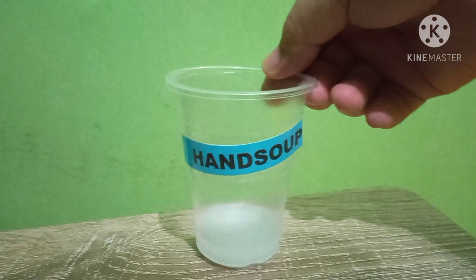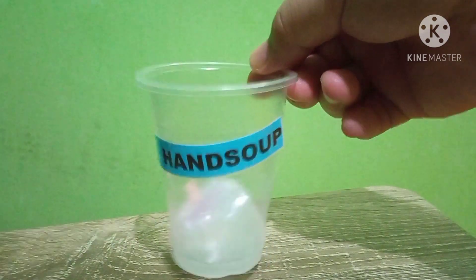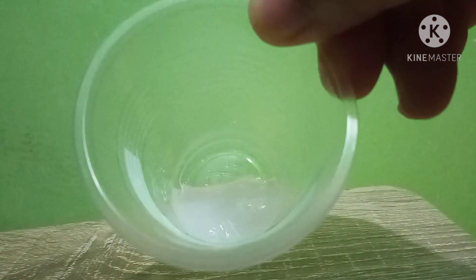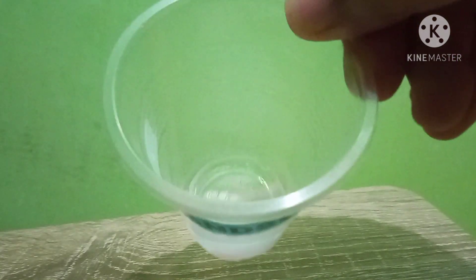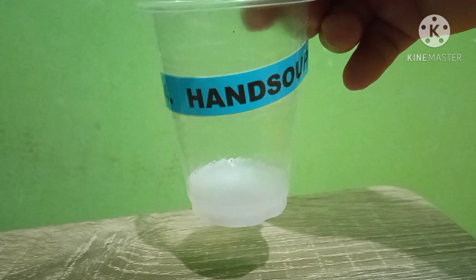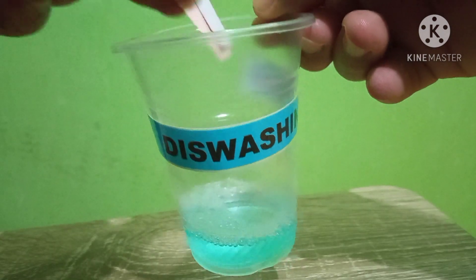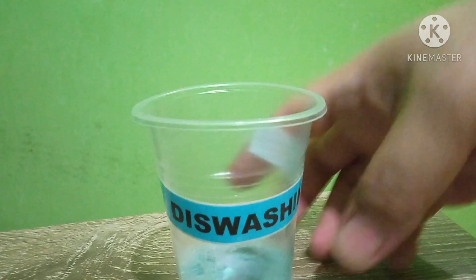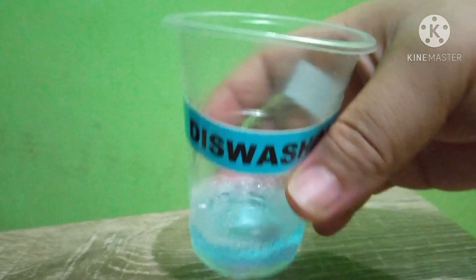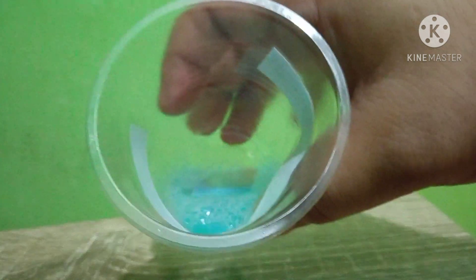Next is number four, Hand Soap. Let's place it in — the hand soap turns blue. Next is number five, Dishwashing liquid. Observe the color change.